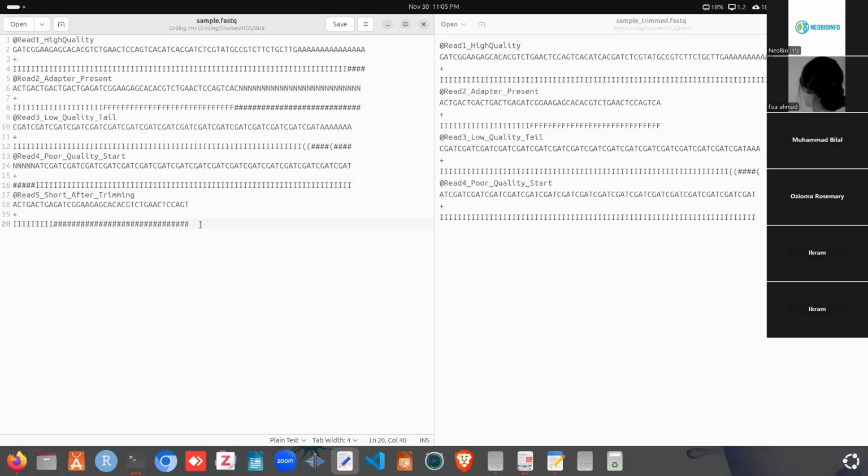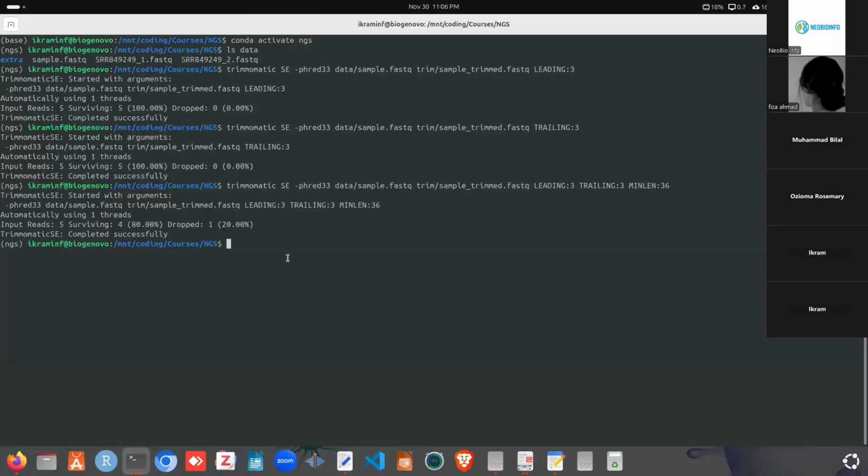So when we want to trim these low quality bases, we will use leading and trailing. These parameters will remove the low quality bases. Leading will check from left to right and trim the bases, and trailing will check right to left and trim the bases. And after trimming, Trimmomatic will check the length of the read. If after trimming the length is less than 36, or the specified length, then it will drop that read. And after that, we can proceed with the adapter content.